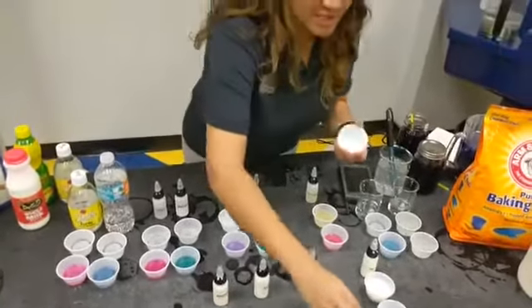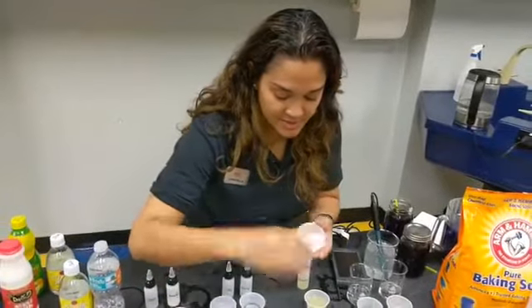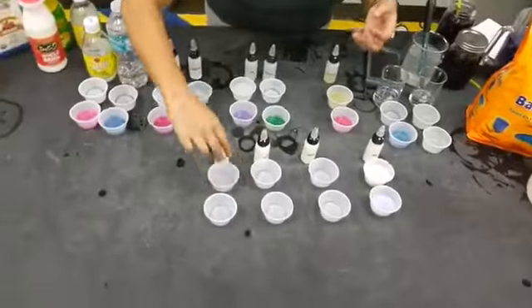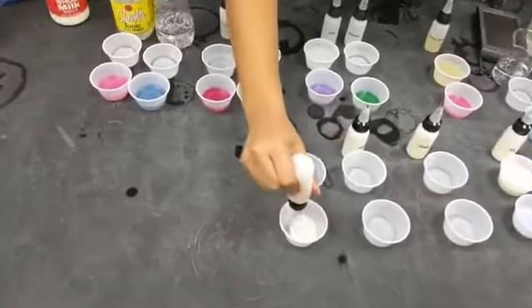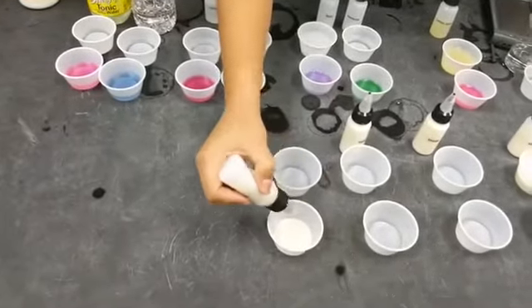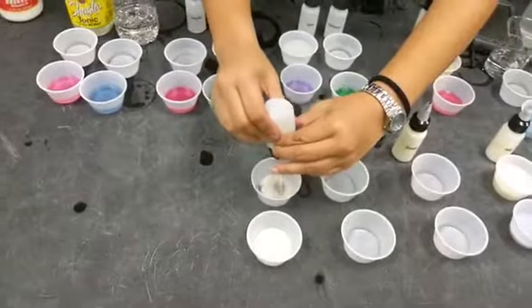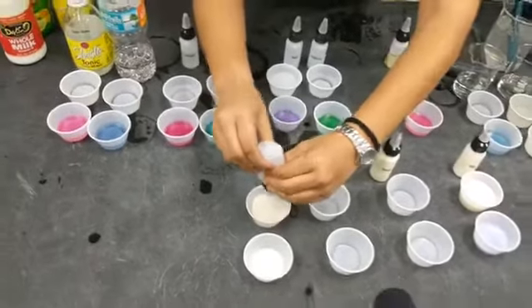So we're gonna do the same thing again, 2 different sample cups. And I'm gonna pour a little bit of sample in the first one for our pH or cabbage juice indicator, and a lot of sample in our second one so that we can dip our entire probe in there.